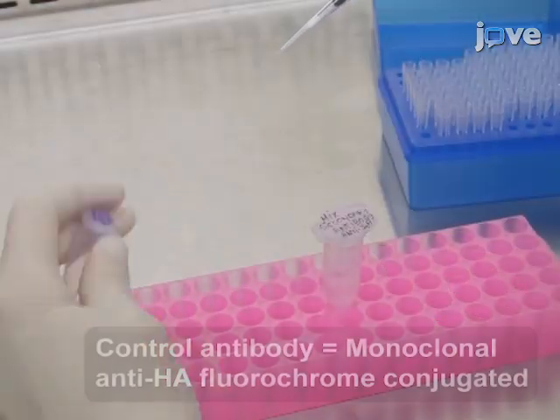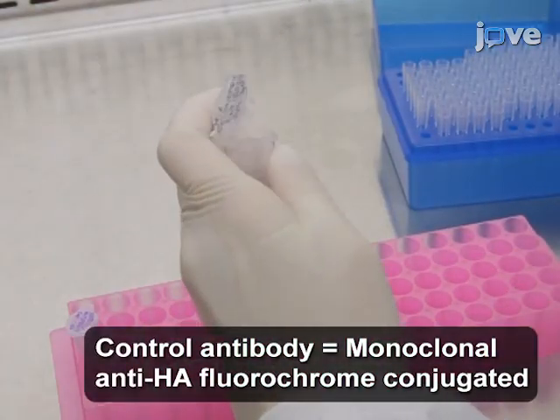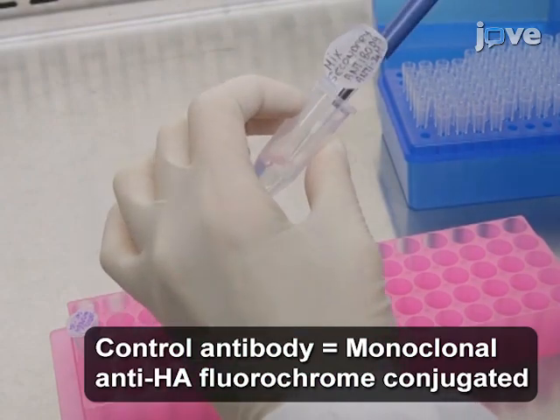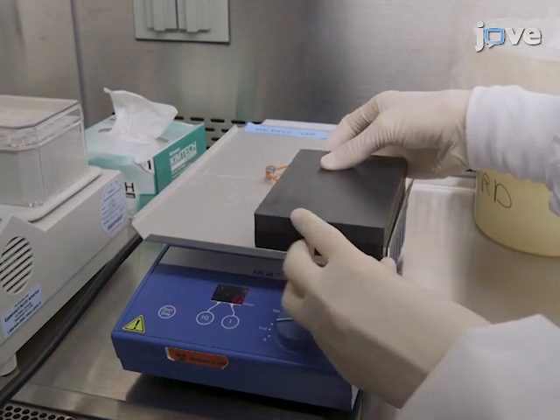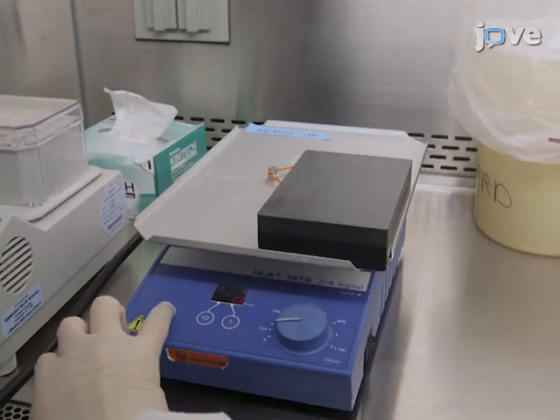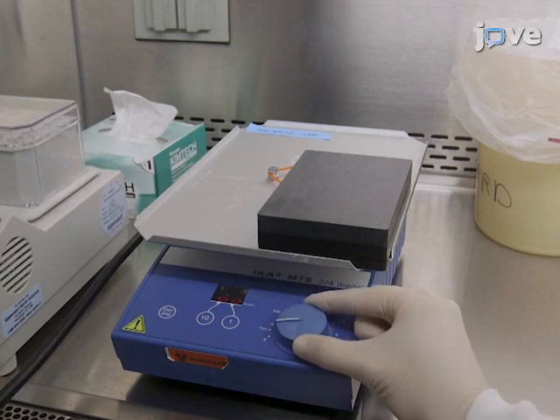Then mix the control-labeled antibody at a dilution of 1 to 1,000 in staining buffer with the diluted secondary antibody. Incubate with the microarray for 30 minutes at room temperature in the dark and on an orbital shaker at 140 RPM.